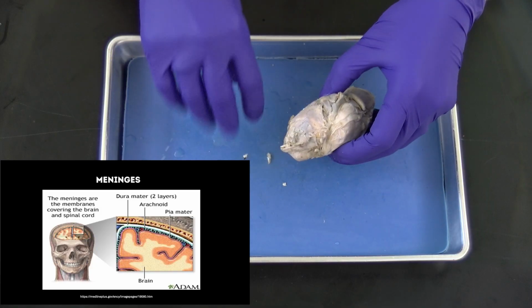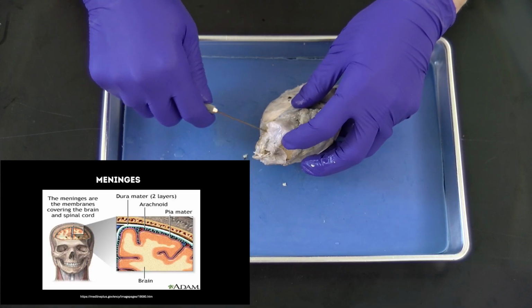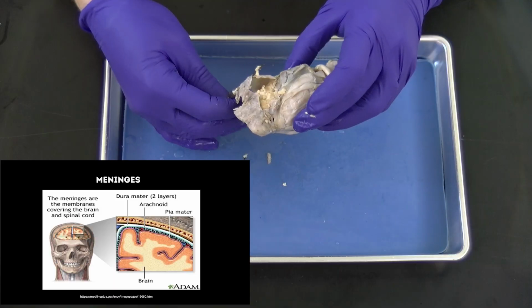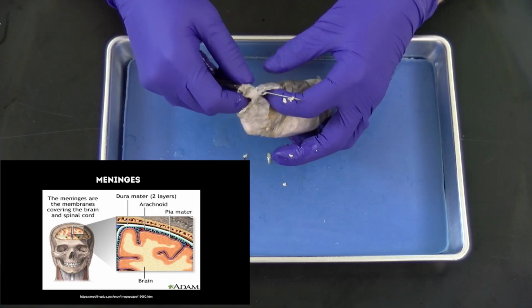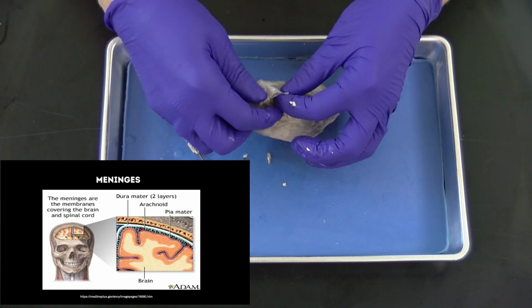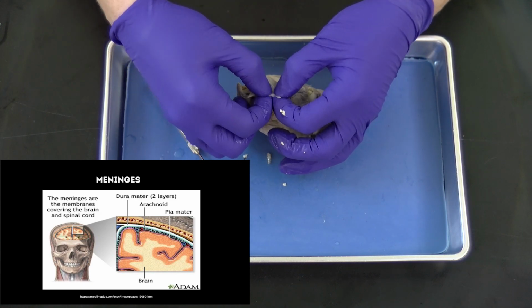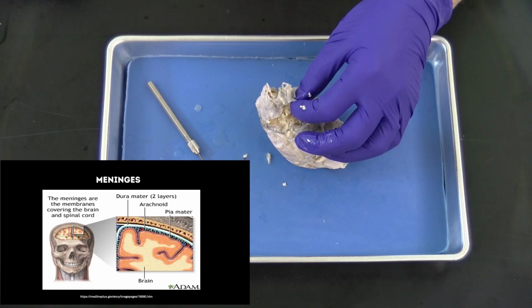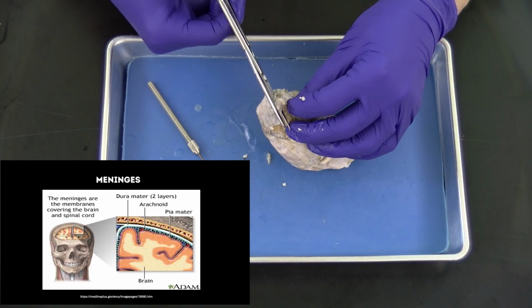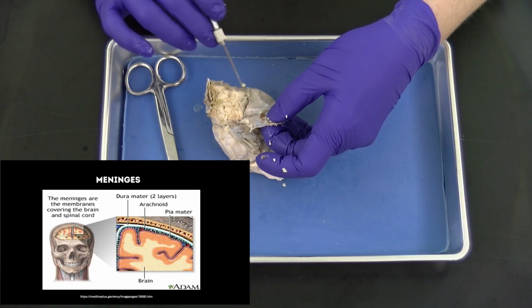So you can see here how it's loose. It's not quite connected to the brain. And this is really thick and tough. I can pierce it with that, but to rip it, I'm really pulling hard right there, and I can't rip that. I can cut through it right there. So we have this beautiful dura mater.